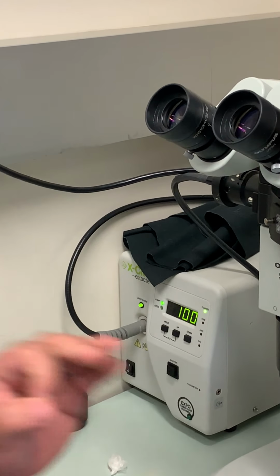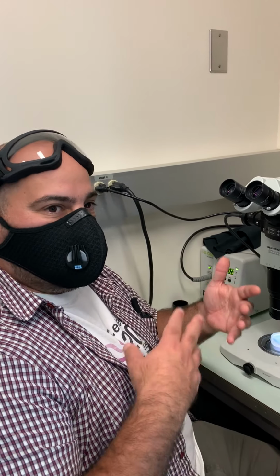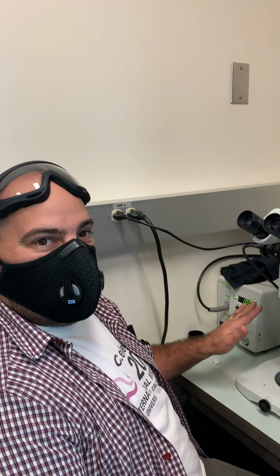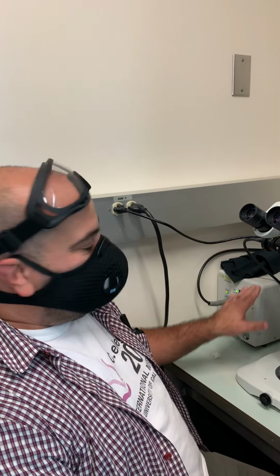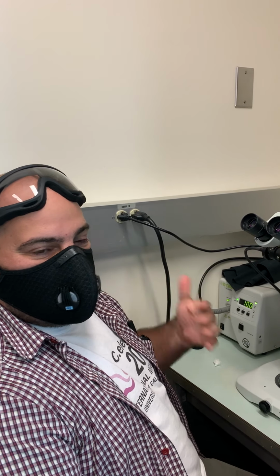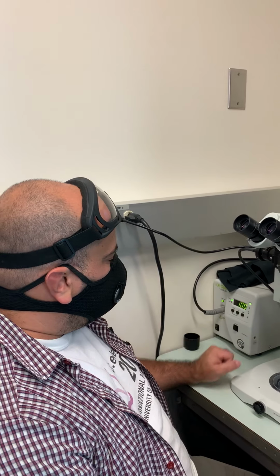Once the power button is on, this needs to be on for the rest of the day. If you are the only person in the lab and you are leaving for the day, then you can turn it off. But if you know that there are going to be more people using it, you have to leave it on, and make sure that the people who come in know to turn it off before they go. The reason is that the lamp inside loses 4 hours of life every time you switch it on. If you turn it off after 10 minutes and somebody comes back and turns it on again, that's 4 hours every time somebody switches it on and off. So we leave it on for the day.